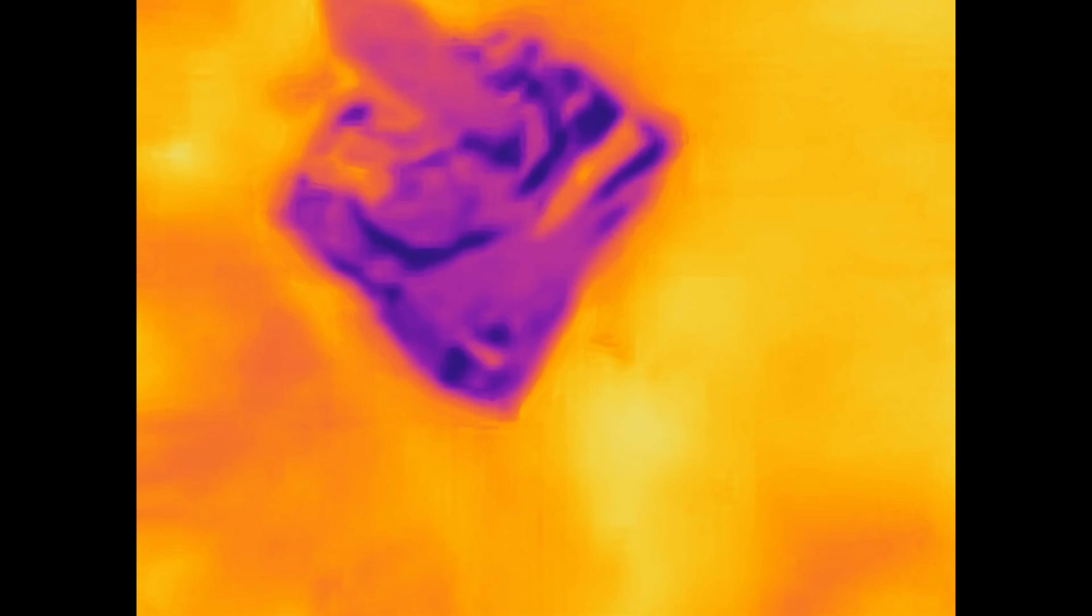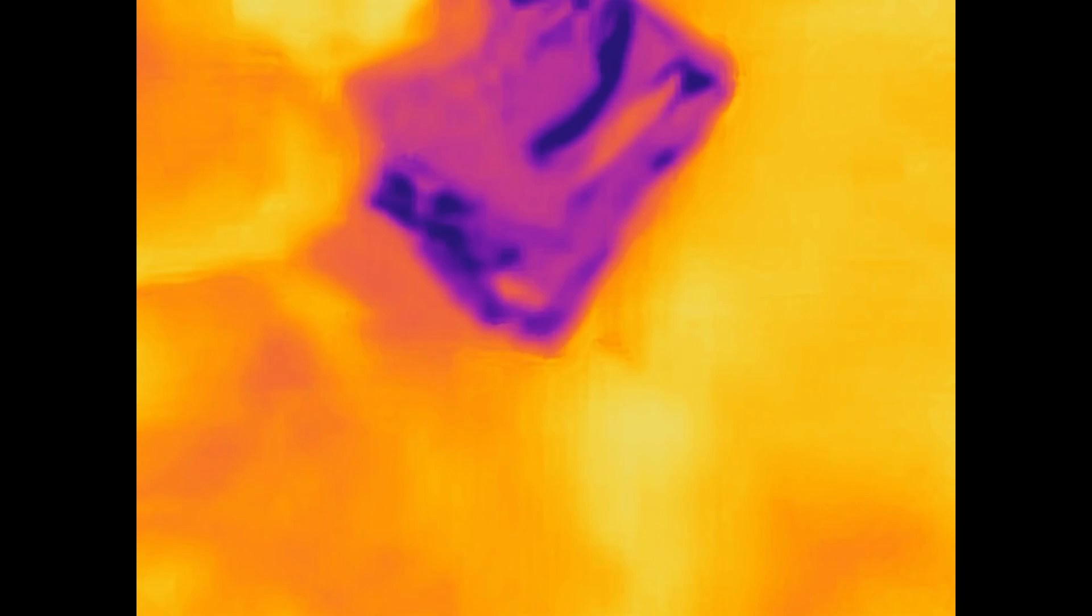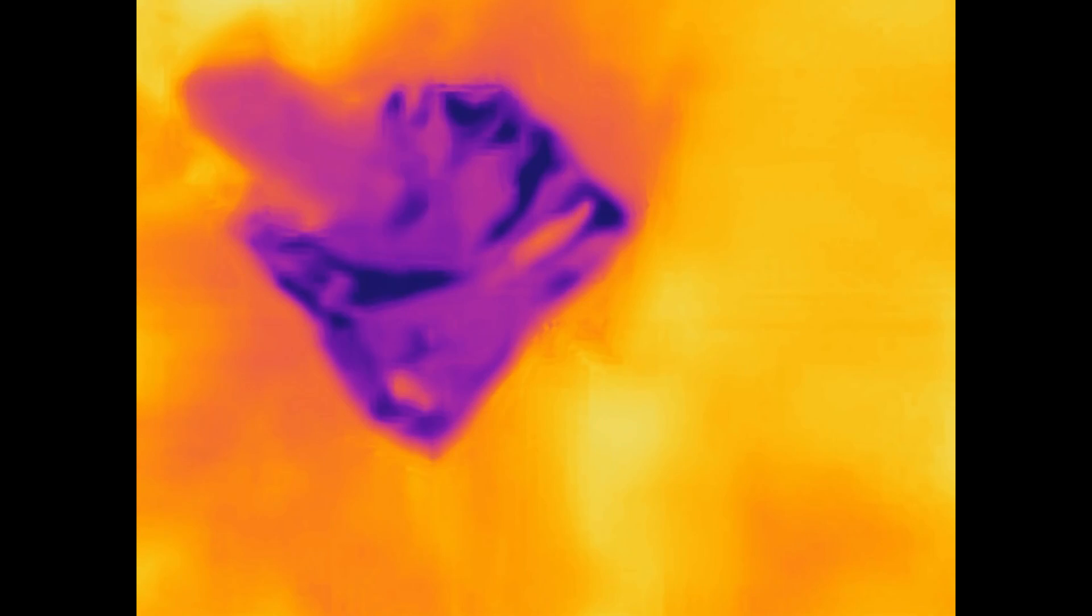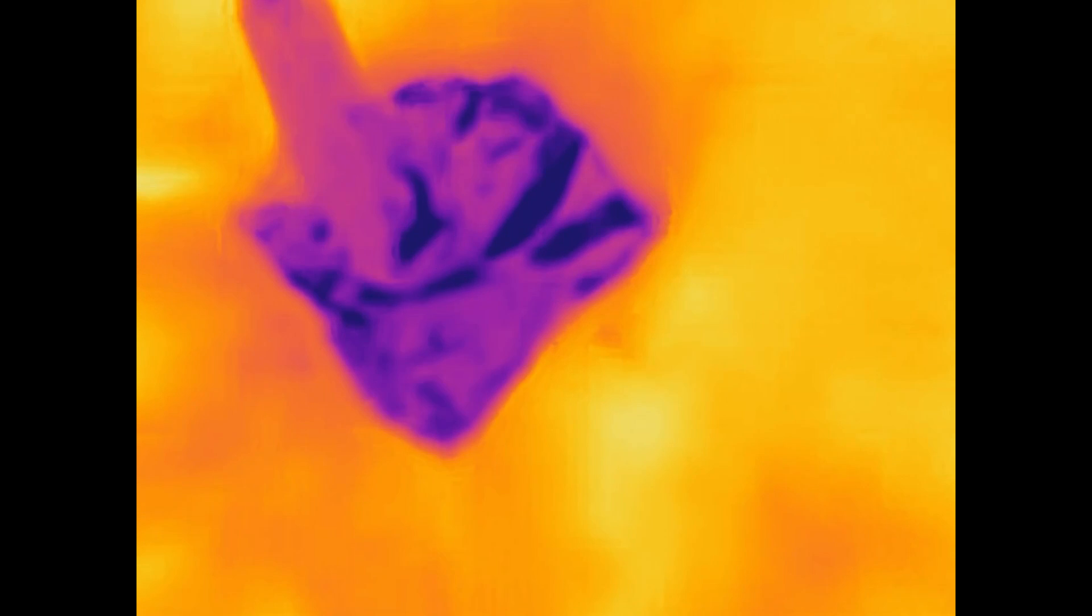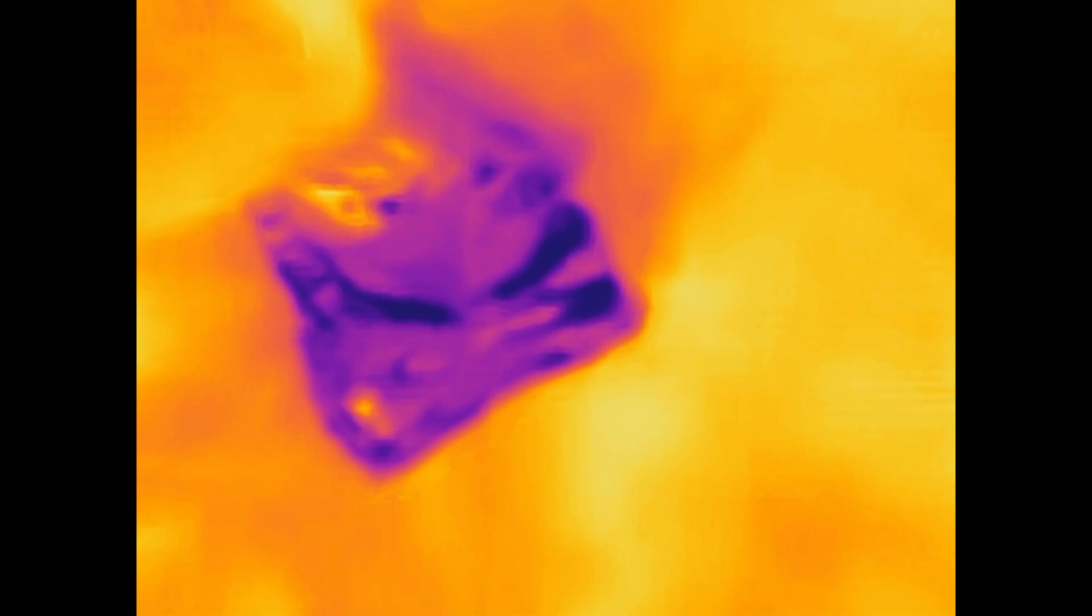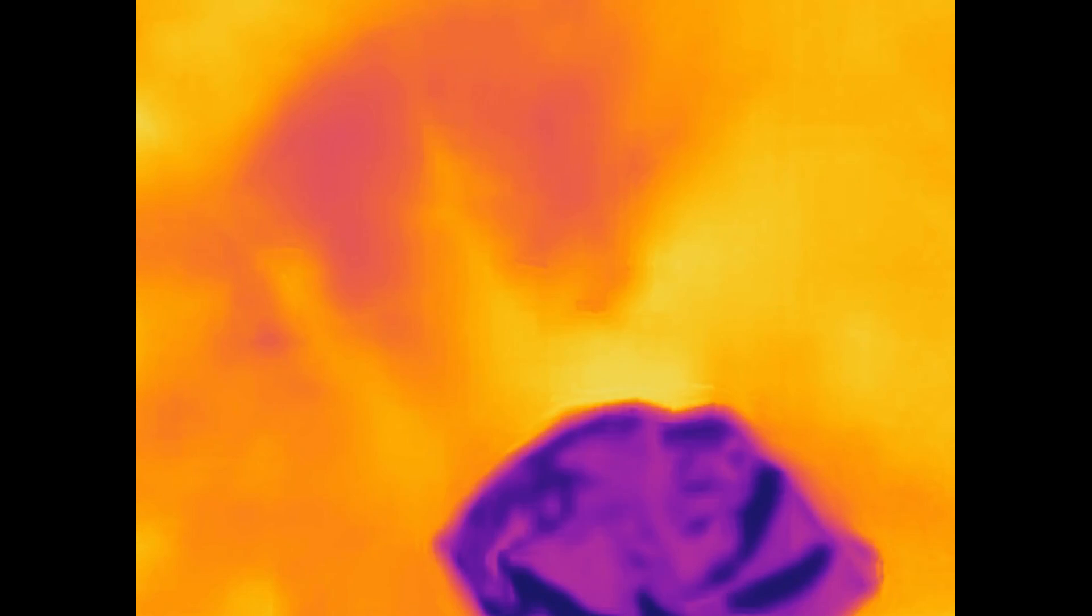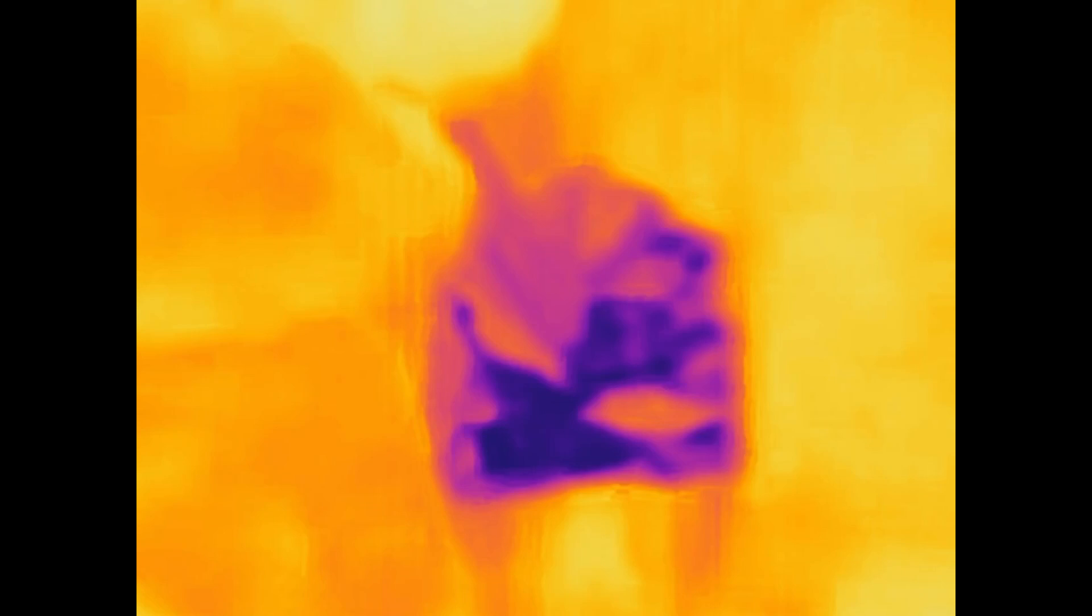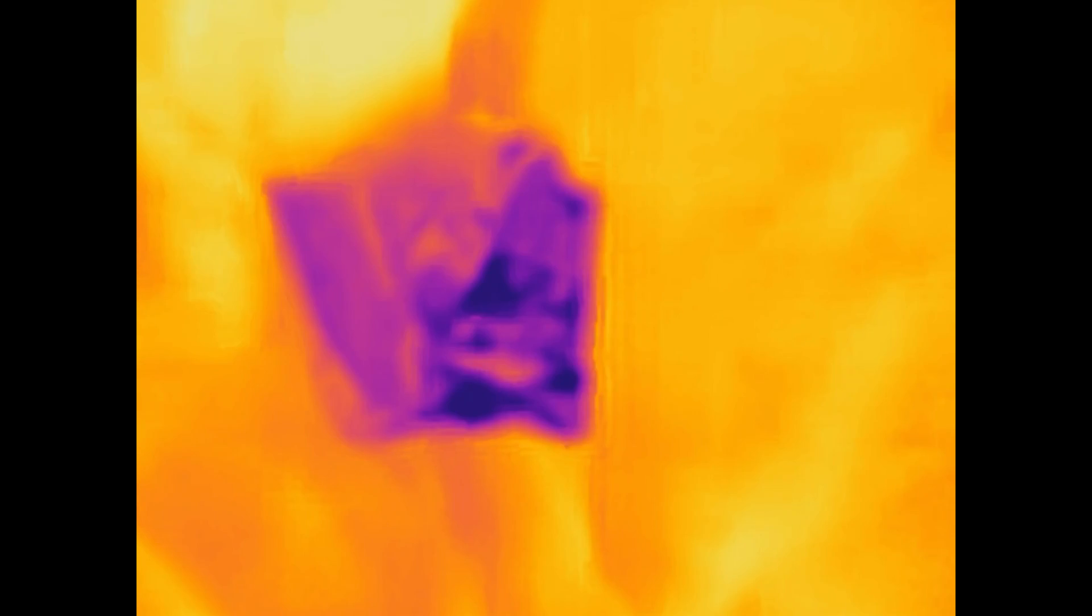Now you can't really see much happening because the metal is mostly just reflecting and showing the temperature of the room, but if I add a bunch of this and let it cool off, you'll be able to see that my hand underneath the metal has cooled significantly. See this spot here? This is actually making it cold. Now, of course, this has only taken it down to about 15 degrees centigrade.